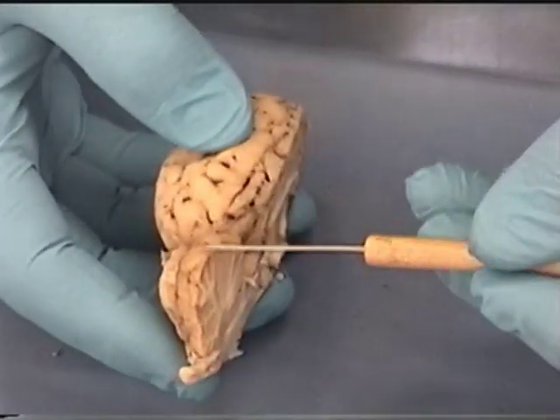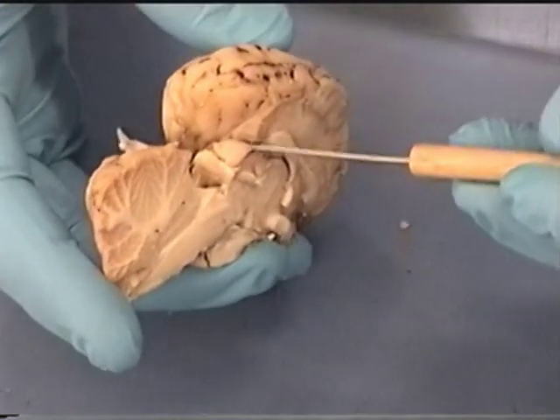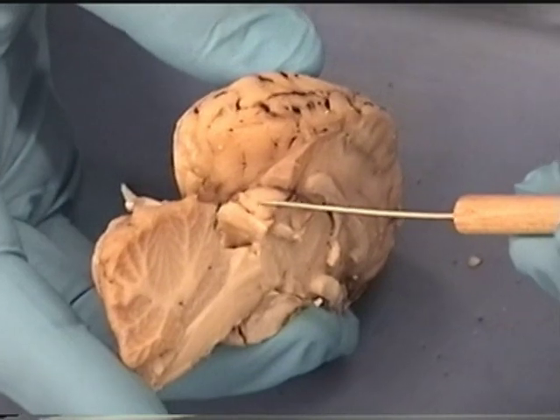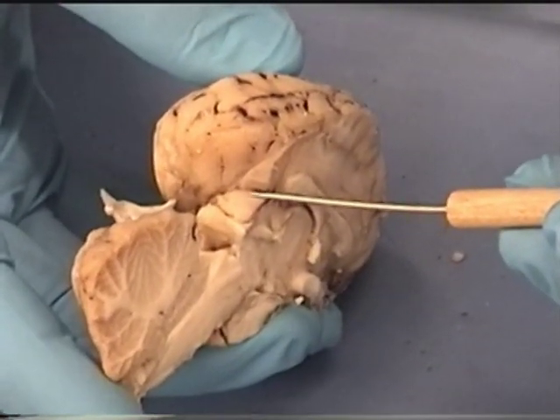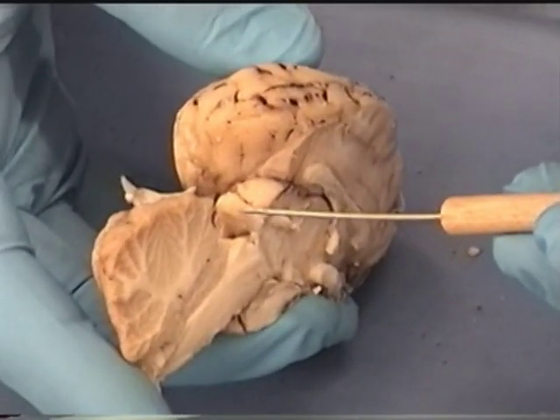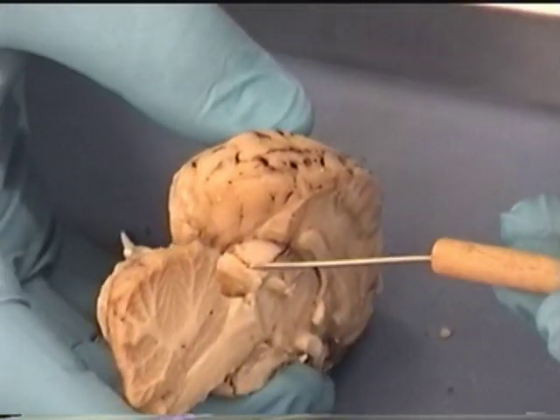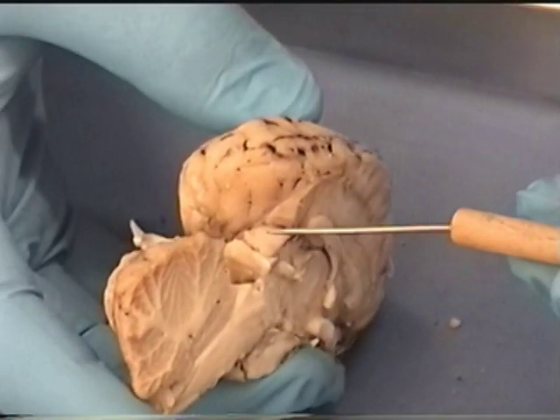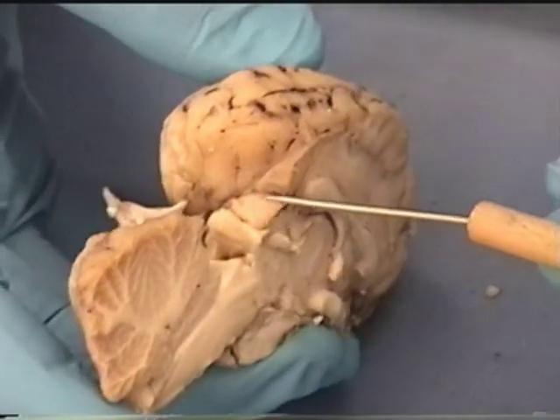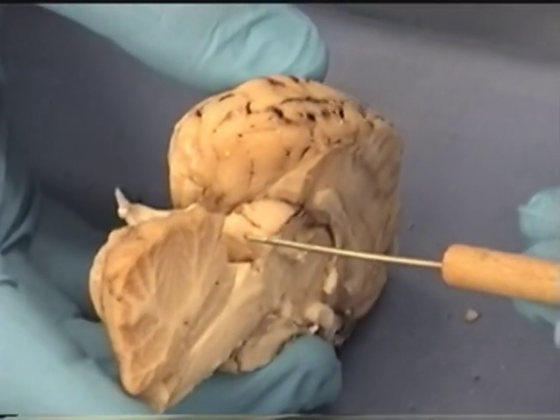As we look at the cerebellum, if we pull it down, we can actually see two bumps on both sides — this is our corpora quadrigemina. The superior colliculus is the upper bump and the inferior colliculus is the lower bump. In the human brain, the upper bump was smaller and the lower bump was larger. In a sheep brain, that's reversed: the superior colliculus is larger and the inferior colliculus is smaller.